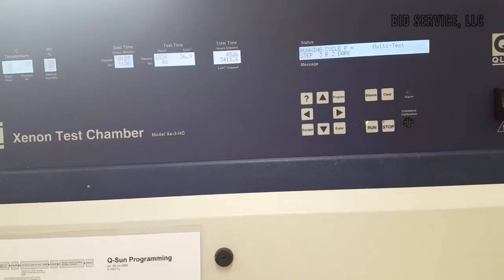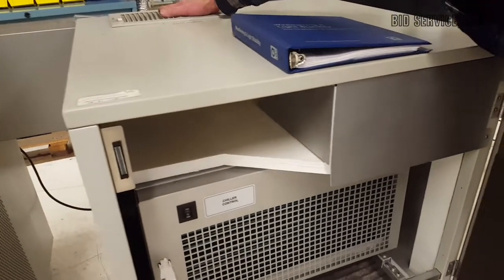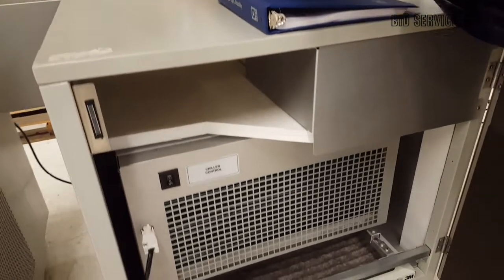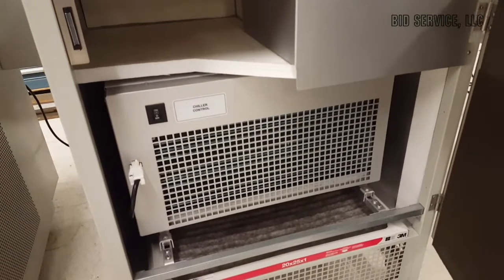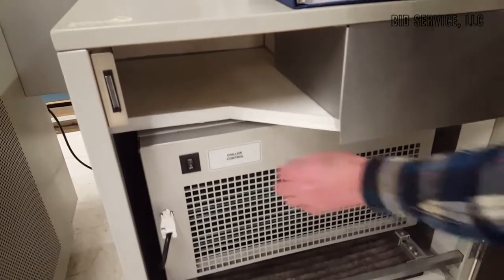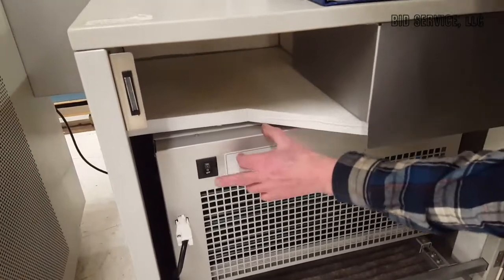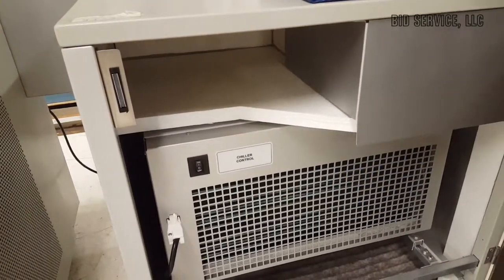Now, notice. Come on over here for a second. Now that we're in this mode, the cooling unit went on automatically. It will start and stop. All you have to do is keep this in the on position and it will run from there.